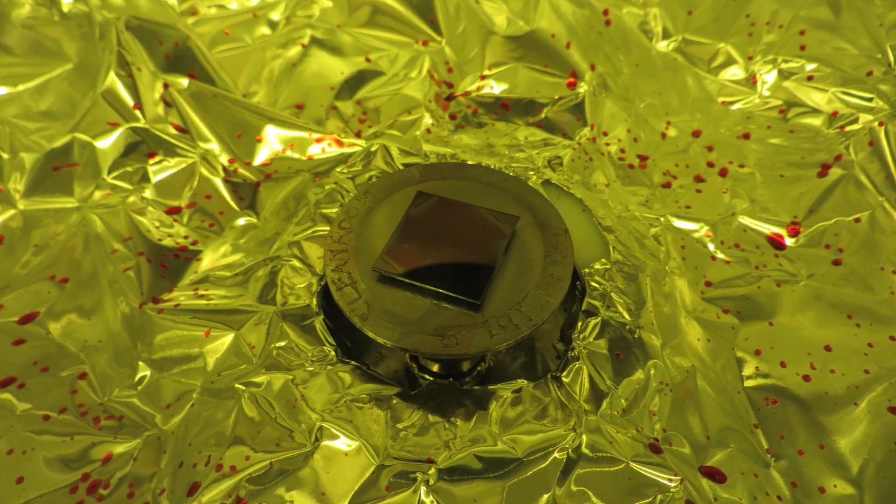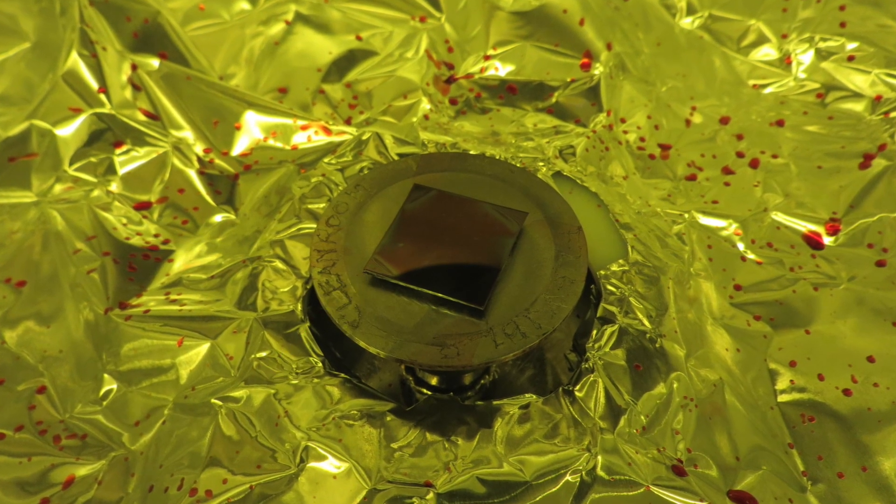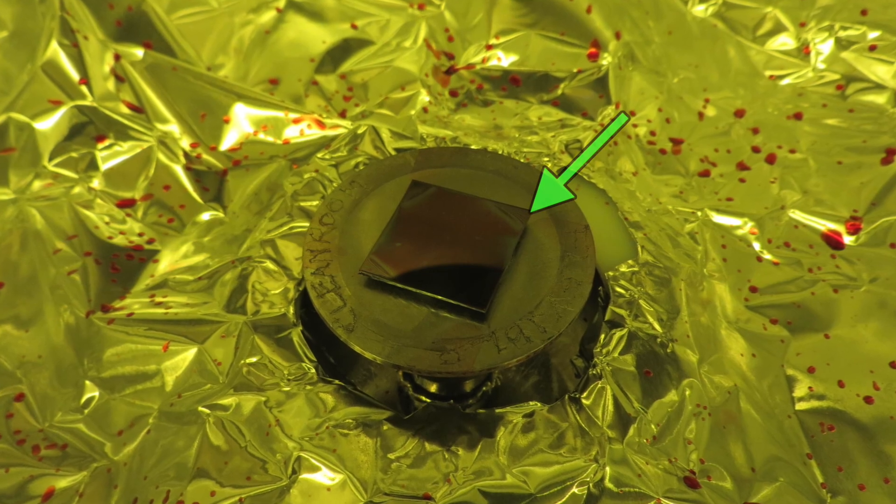If the sample flies off but you don't see this vacuum error code, it means there's a problem with the vacuum circuit in either the spinner shaft or up in the head casing. If you do get this vacuum error warning, you can reset the spinner by hitting the green floor switch again.